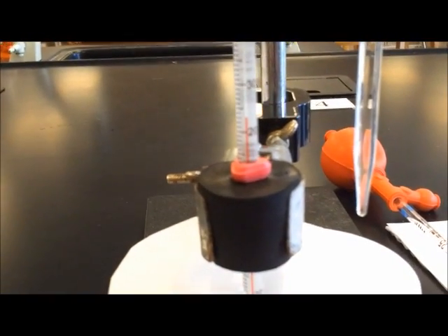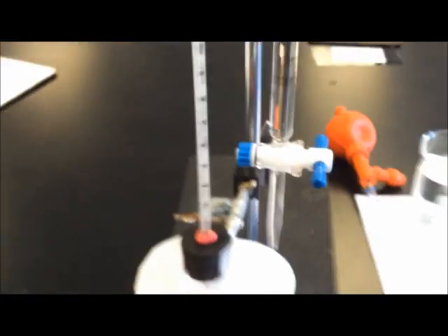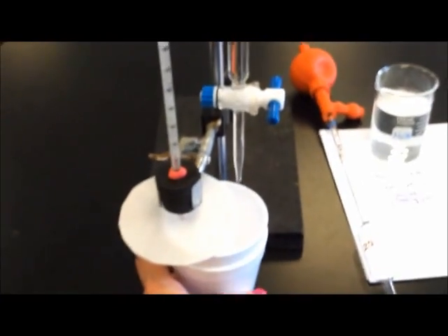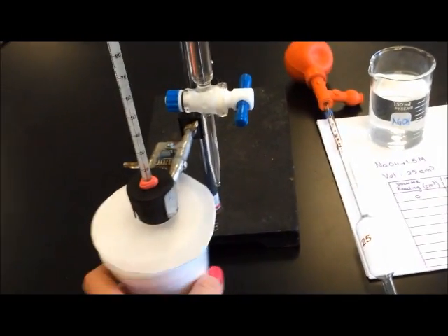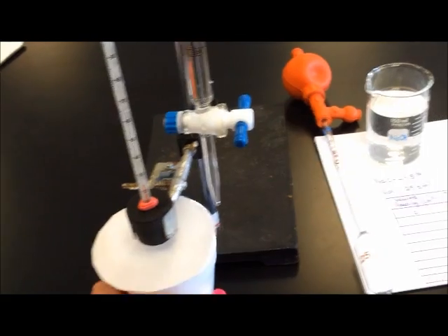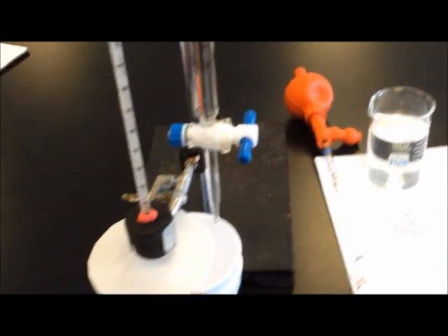We also will place a lid on the styrofoam cups to prevent heat loss, and we're going to be cutting it so as to be able to drop certain amounts of volumes of the acid on the base and be able to swirl it.